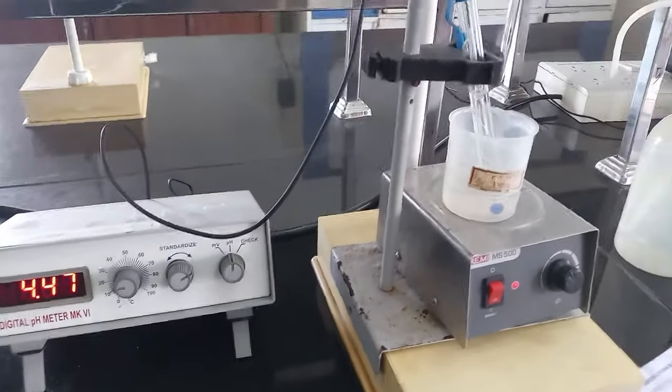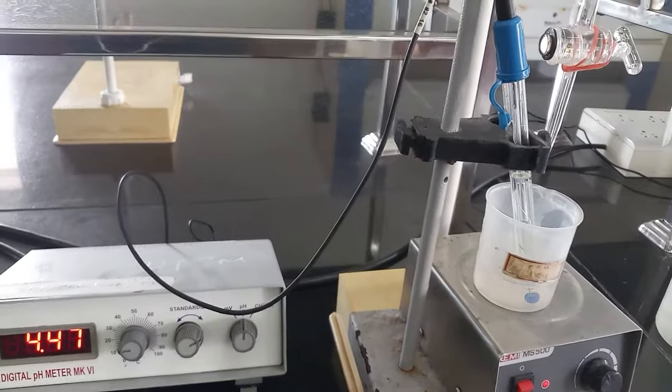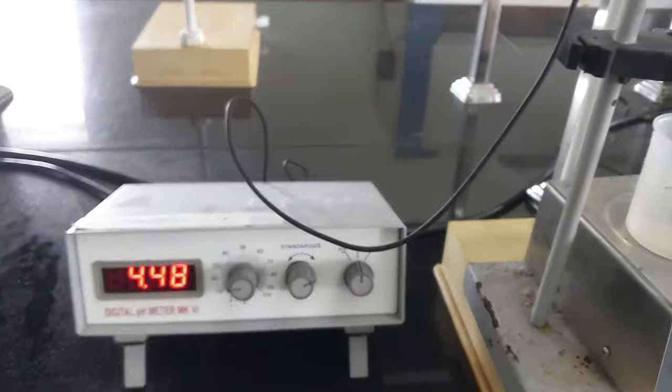Hello friends, in this video let us see how to determine pKa of weak acid using pH meter.